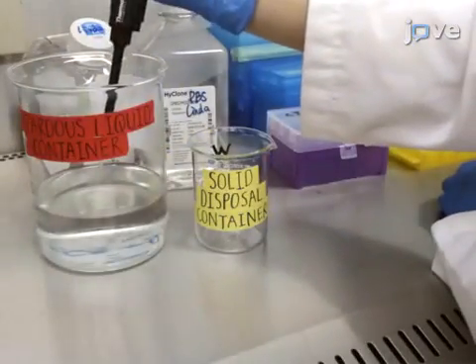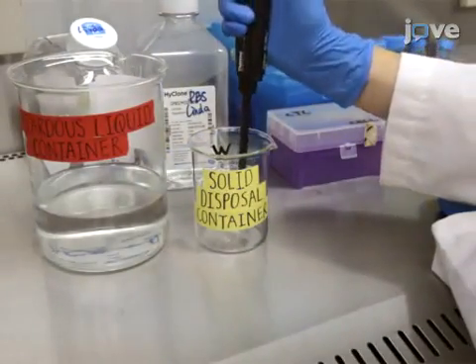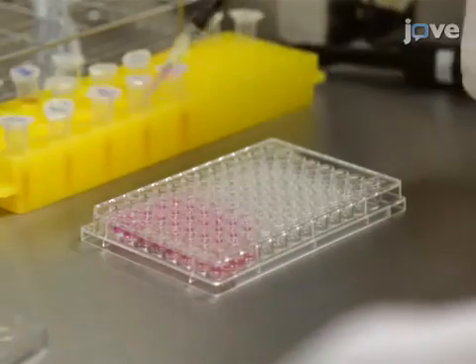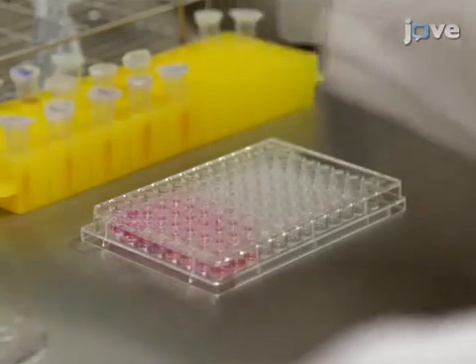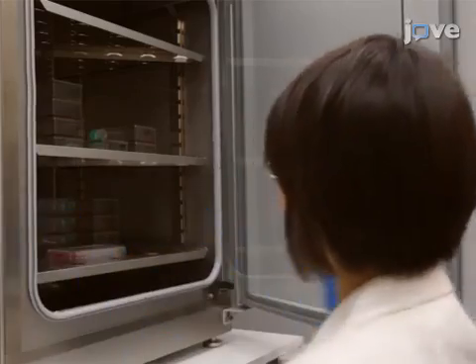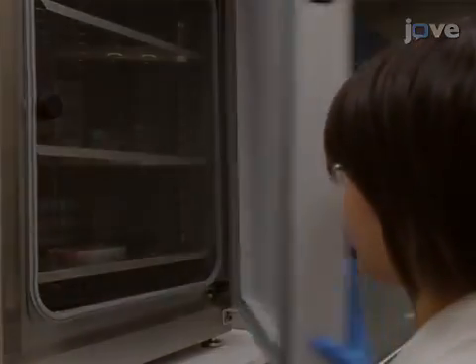Remember to follow biosafety level 2 procedures throughout the experiment. To test the cytotoxicity of the test compounds, treat the cells with increasing concentrations of CHLA or PUG from 0 to 500 micromolar diluted in basal medium, or 1% DMSO as a negative control. Then incubate the cells for 72 hours at 37 degrees Celsius in a cell culture incubator.